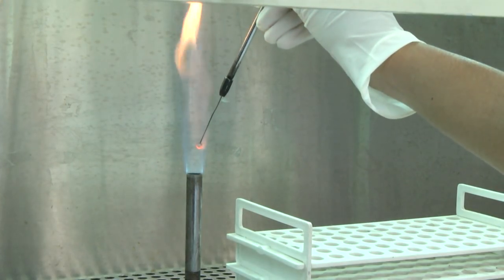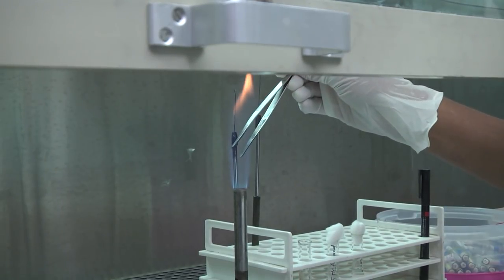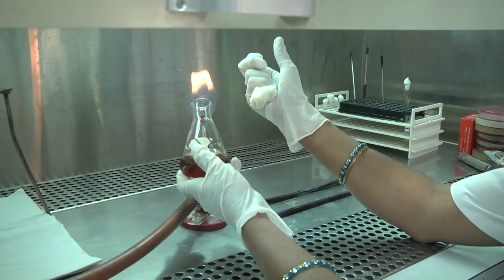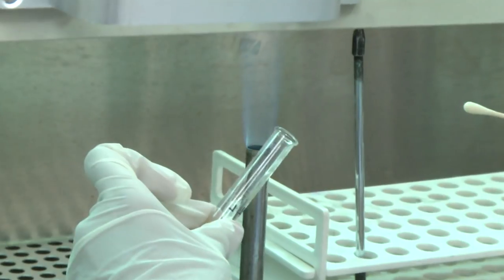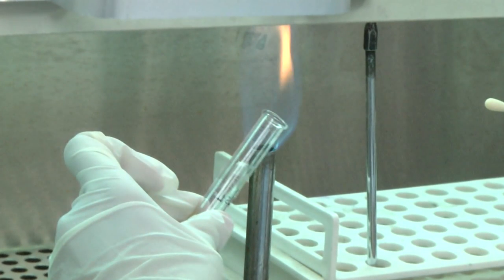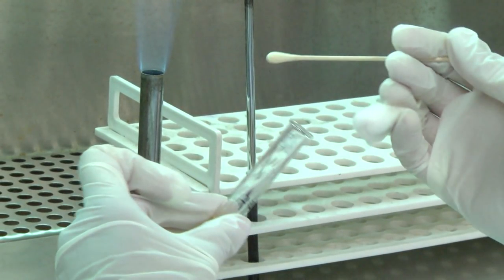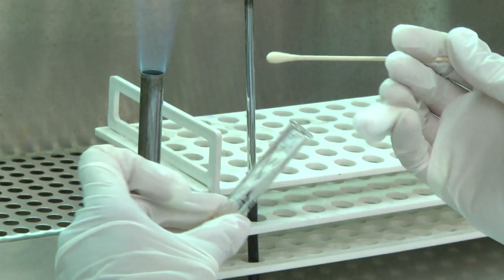Flame to sterilize wire loops, straight wires, and metal forceps before and after use. Flame the necks of specimen bottles, culture bottles, and tubes after removing and before replacing caps or plugs. When inoculating, do not let the tops or caps of bottles and tubes touch an unsterile surface.